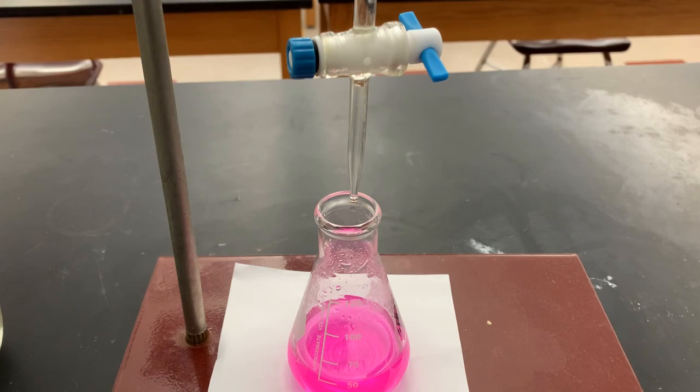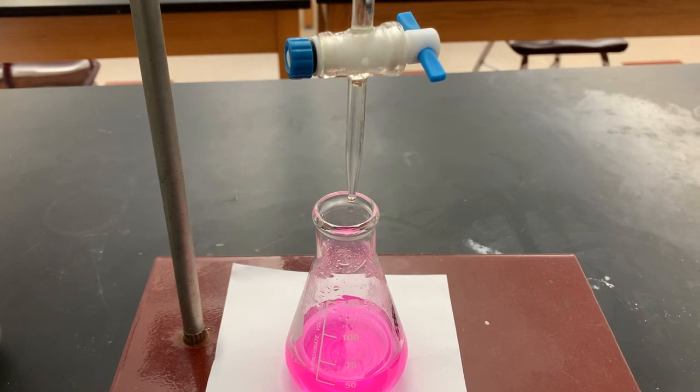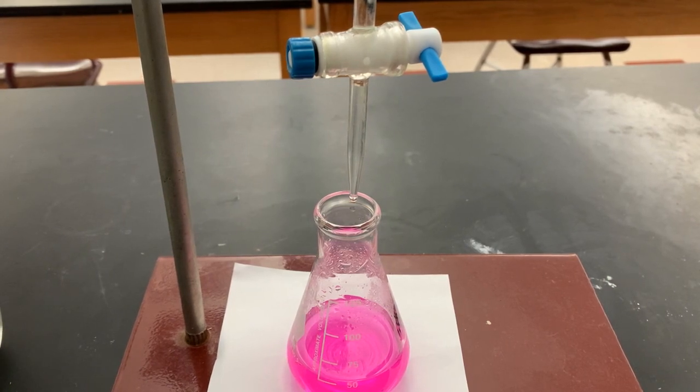But what we're looking for is for it to be as pale as possible. I couldn't have done any better than adding a single drop. Sometimes there's some luck of the draw involved in getting a pale pink versus a not so pale pink. But the burette allows us to have really fine control over the volume. At this point, we would want to record our final burette reading, and we can dump this solution down the drain and repeat this procedure for a second trial, making sure to rinse your flask in between.